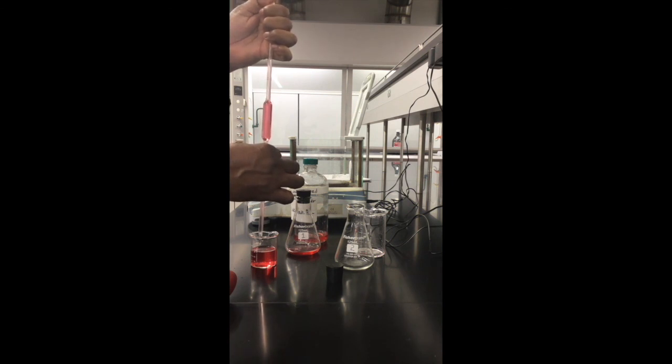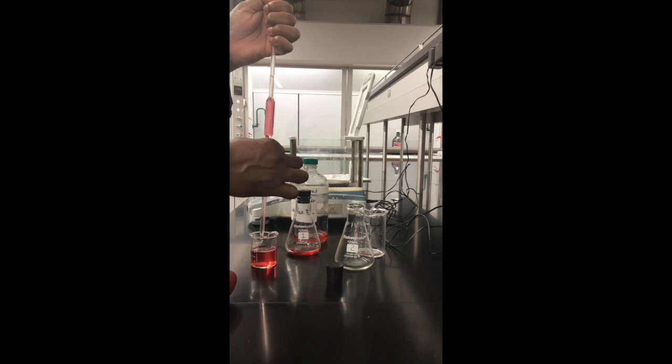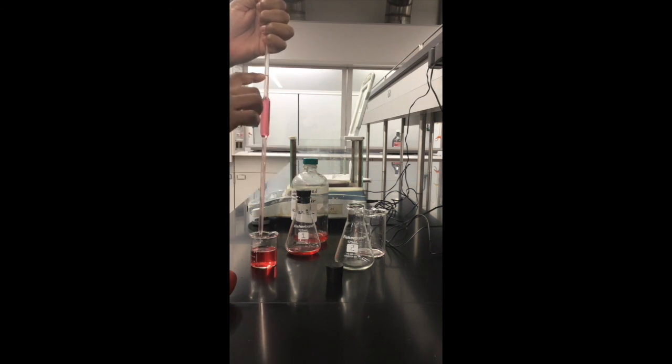I'm just gonna let the air in. Slowly, the meniscus is dropping. Right there, I have the meniscus by the calibration mark.